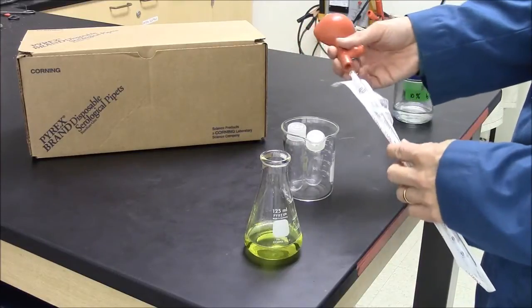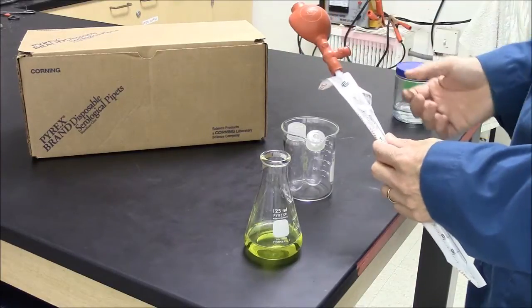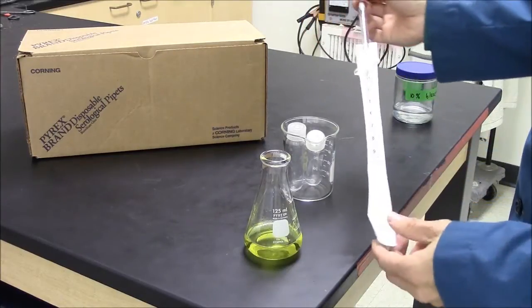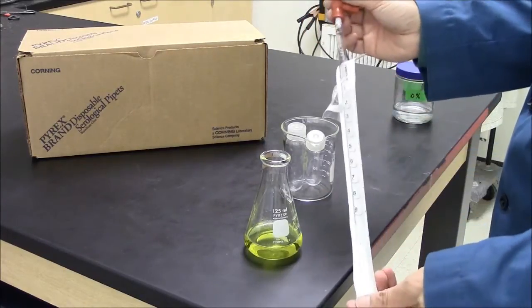Use a pipette bulb. Don't jam this on too tightly, just secure. And now I can pull up some of this solution using my pipette.